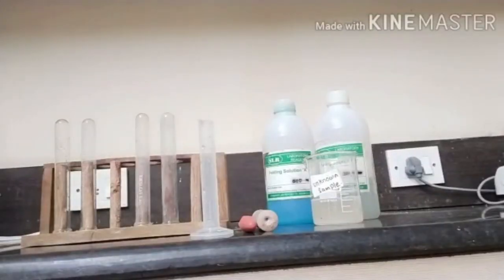The first test, the test for carbohydrate. In this test, we perform any two tests: Fehling test and Benedict test.